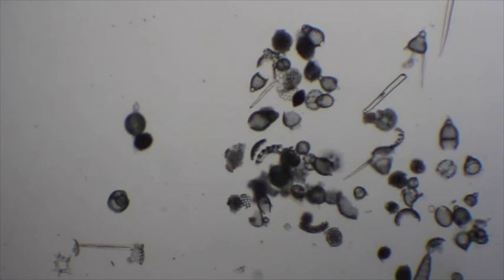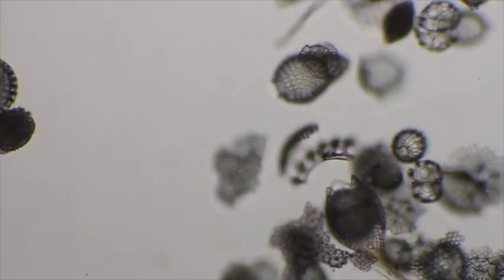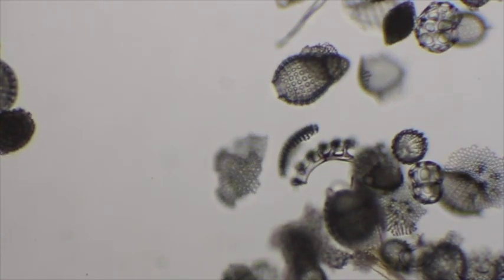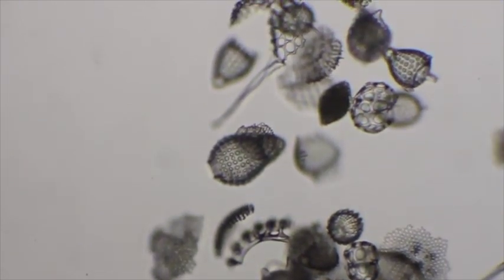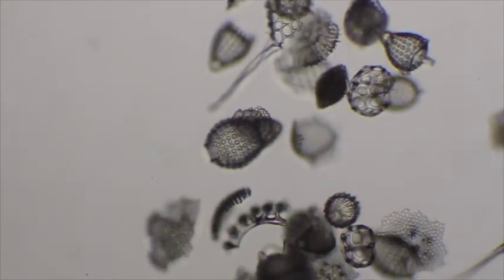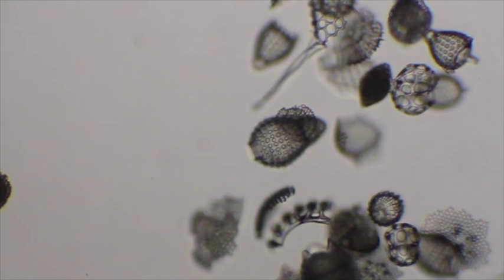Okay, so now we're looking at a slide of radiolarian tests or shells. The title on the slide is Radiolarian Ooze. I'm under 4x or 40x magnification right now. We'll shoot up to the 10x, total of 100 times magnification. And these are really kind of neat. You can see these shells, see all those little teeny tiny itsy bitsy pinholes in these shells. Those are basically what allow the pseudopodia to stick out. The pin-like pseudopodia can stick all out of all those shells. It's actually pretty cool looking.